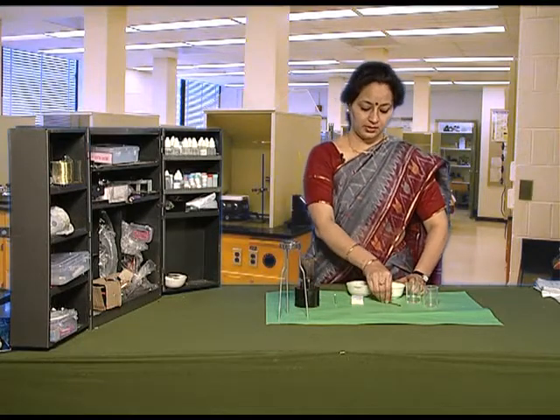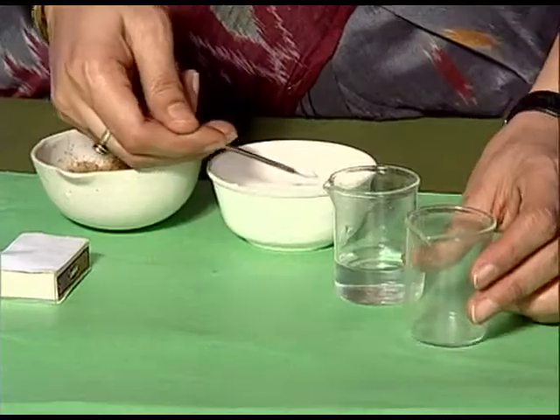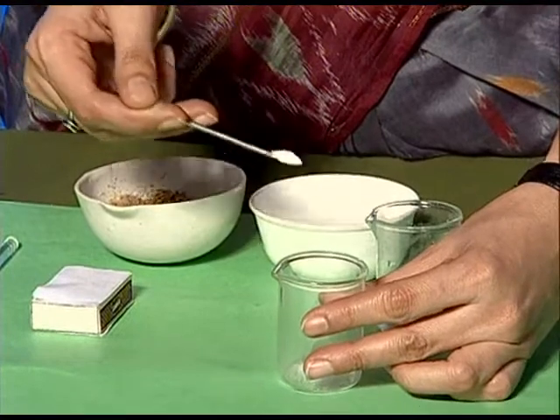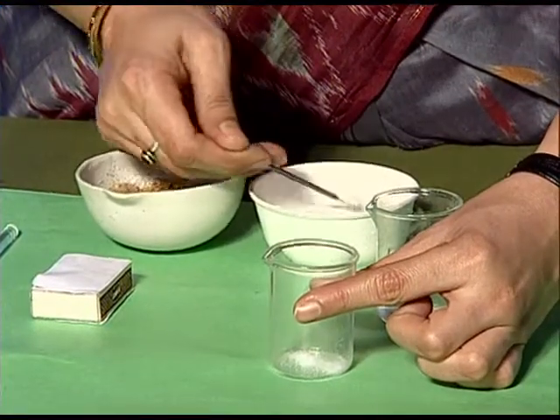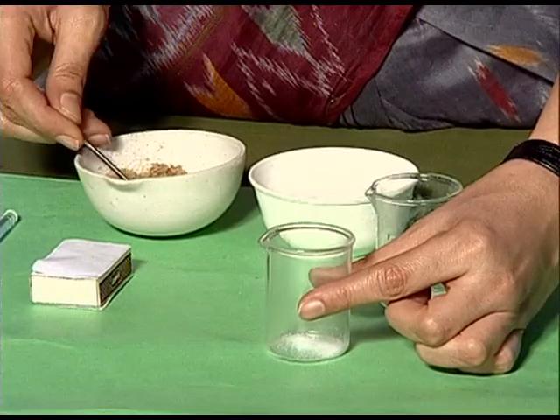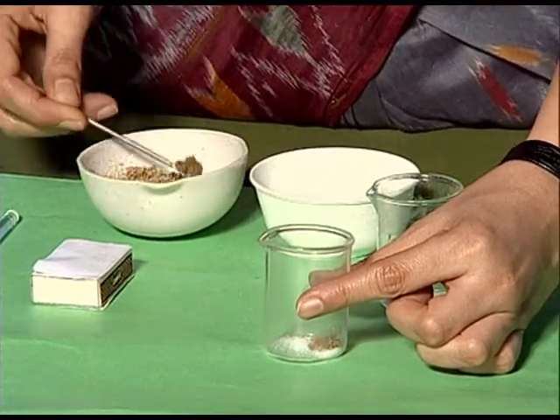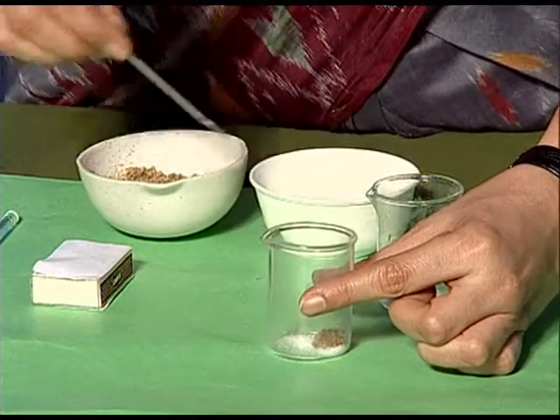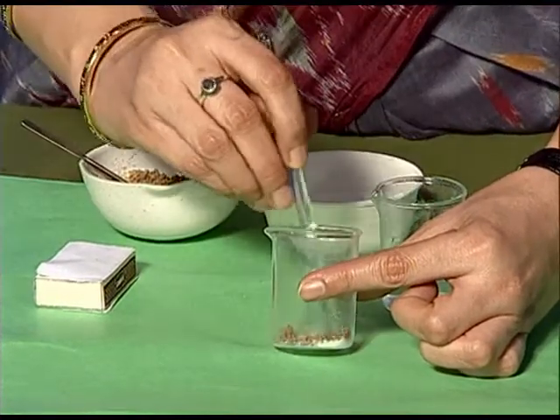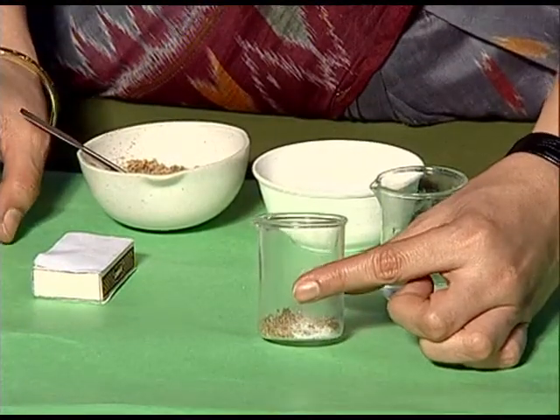First, we will take a small amount of salt in a beaker. Add sand to it. Now they have formed a mixture.